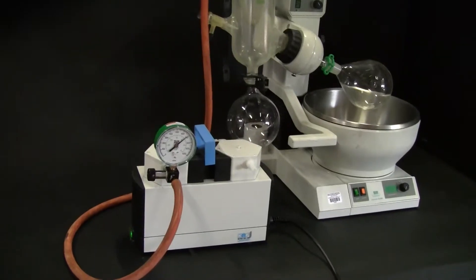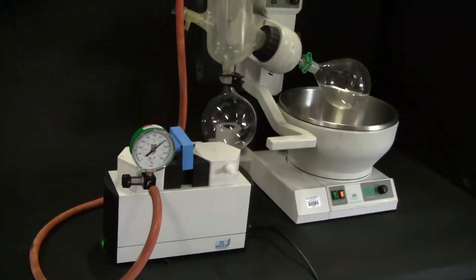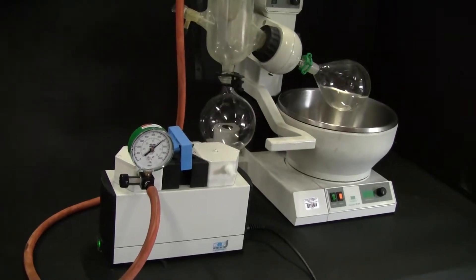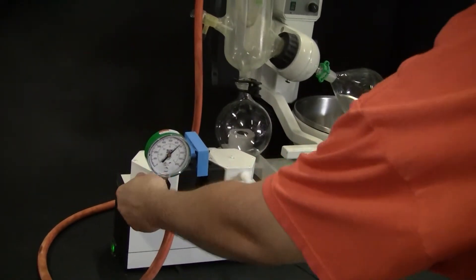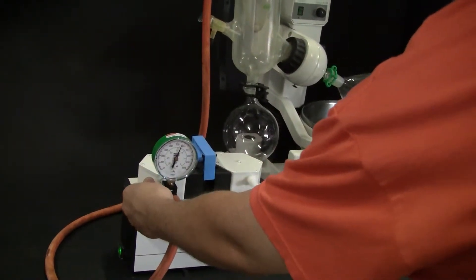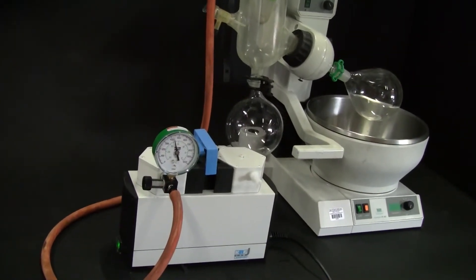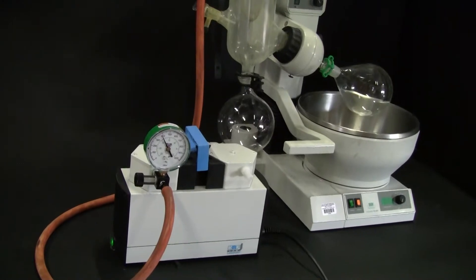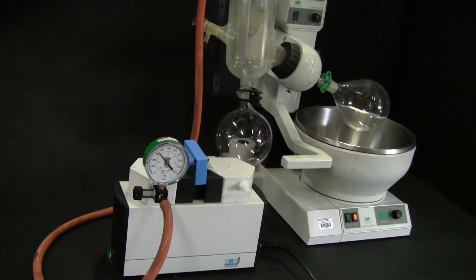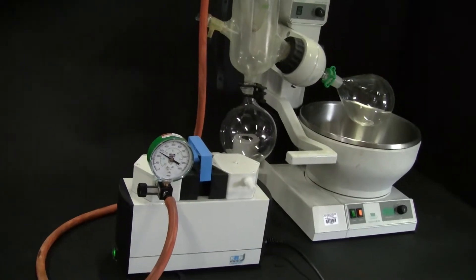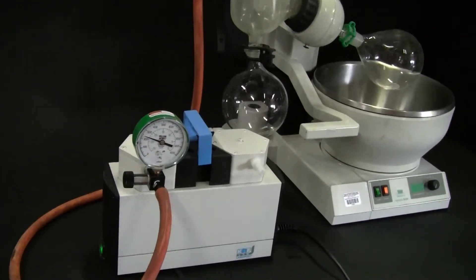I don't need two pumps, I know where I am approximately, but if I want to draw down more vacuum, again, adjusting that needle valve. So on a one liter Roto-Vap setup.